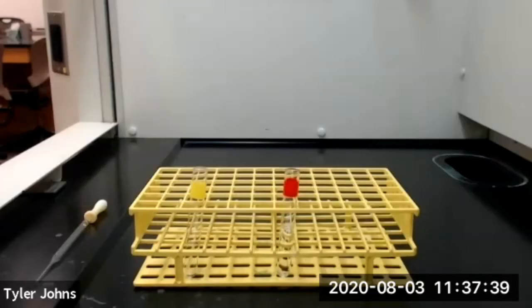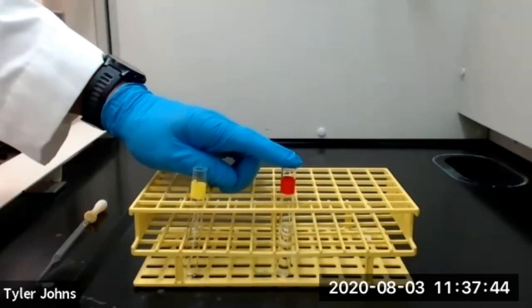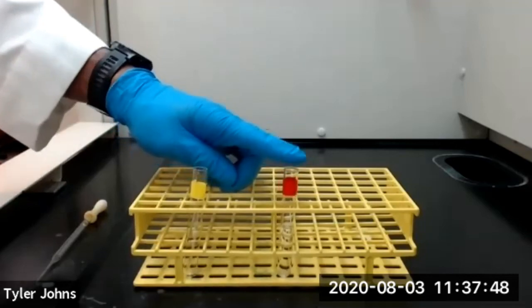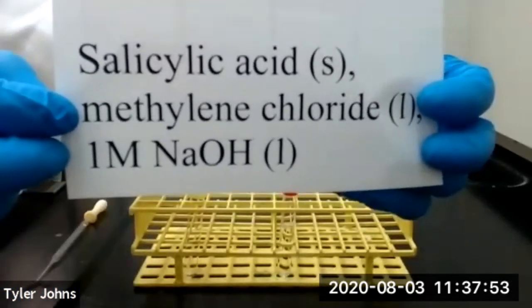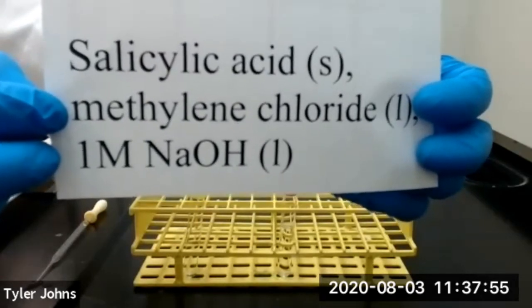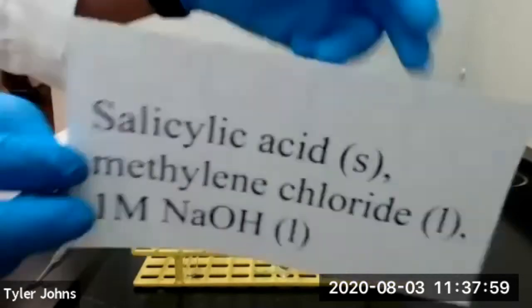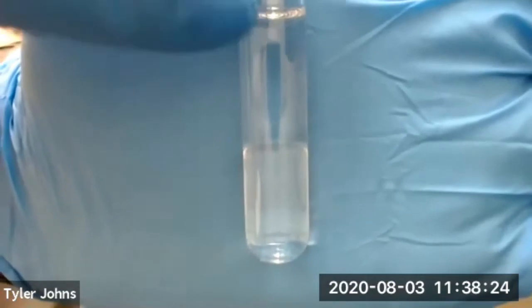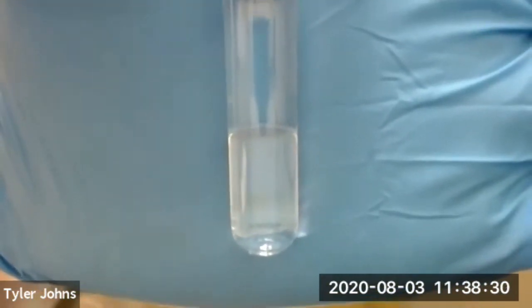In section 2 of part E of this experiment, we've been given a test tube containing 2 immiscible solvents and an organic compound dissolved in one of those solvents. What we've been given in our test tube is the solid salicylic acid and the liquids methylene chloride and 1 molar sodium hydroxide. If we look at our test tube closely, we can see that we have 2 layers. We have our top layer and we have our bottom layer. Those are the 2 immiscible solvents in our test tube.